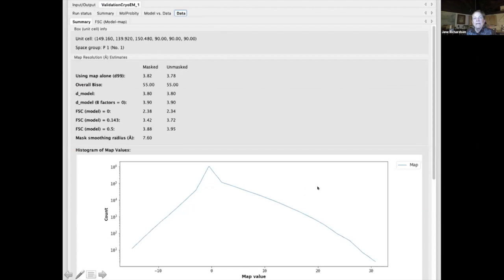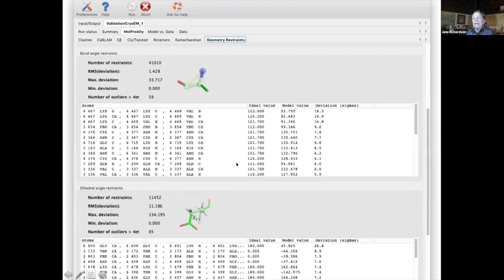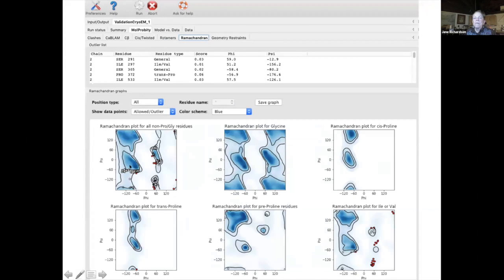And again, you've seen some of these model to map validations. And of course, one of the great things in Phenix is when you find an outlier, you can go and look at it in COOT. Here's a plot for rotamers. And again, you can take an outlier and go and look at it. And Ramachandran plot. Now this is the one here was very badly mishandled. That's a really poor Ramachandran plot, particularly obvious in the general case here and in the Ile/Val case.